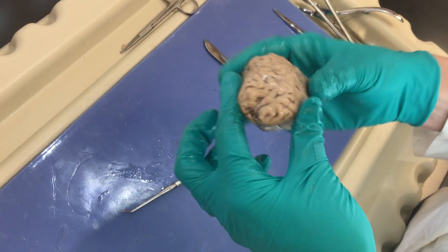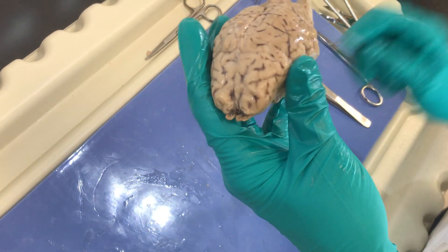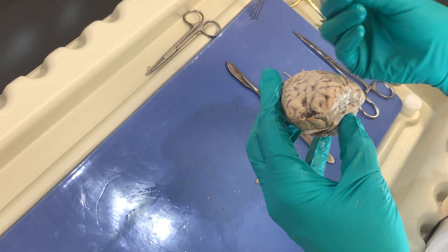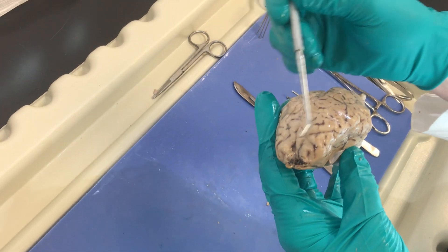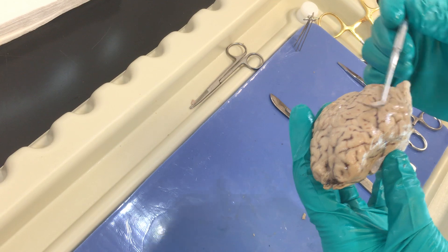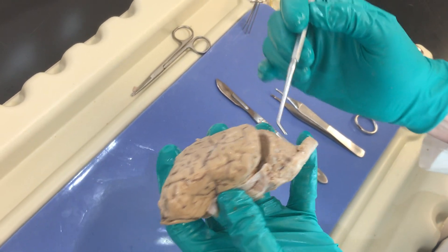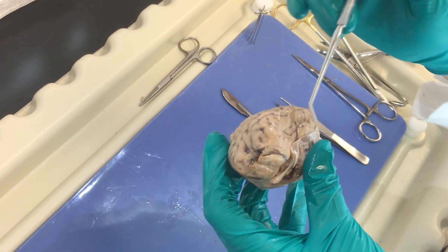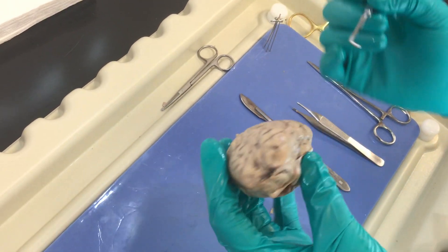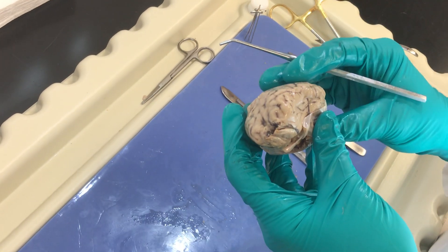Looking externally, we're gonna focus on this specimen right here. This upper portion is gonna be the cerebrum, and we have some very important lobes. We have our frontal lobe here. We have the parietal lobe, which extends over the posterior dorsal aspect, and then we have the occipital lobe, which is right next to the cerebellum. Laterally we have our temporal lobe on either side. There's also a hidden insular lobe which is deep to this tissue — we're not gonna look at that today.